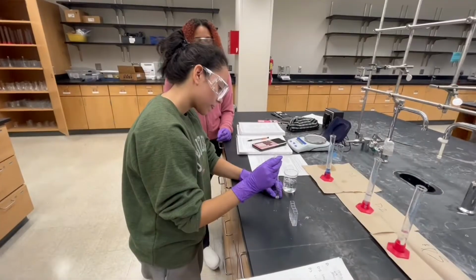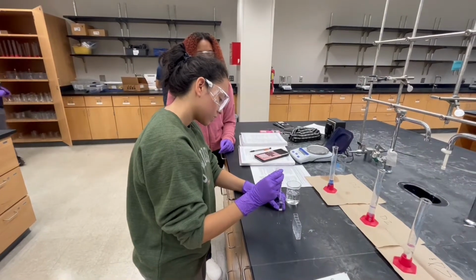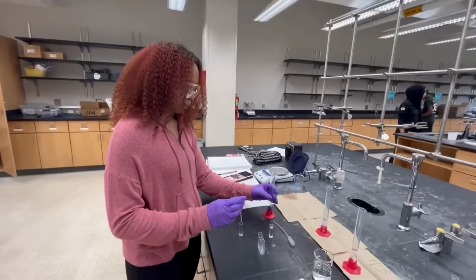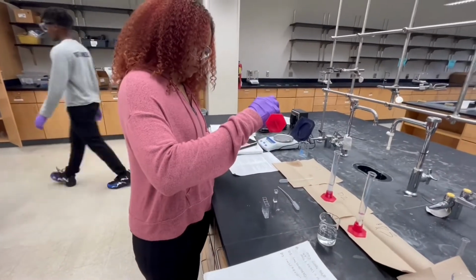We started with a stock solution of copper amine with a 0.02 molar concentration. After making 3 dilutions from this concentration, we will measure the absorbance of each dilution by using a spectrophotometer. The spectrophotometer works by shining a light through a solution, while a detector on the other side gathers how much light was absorbed.